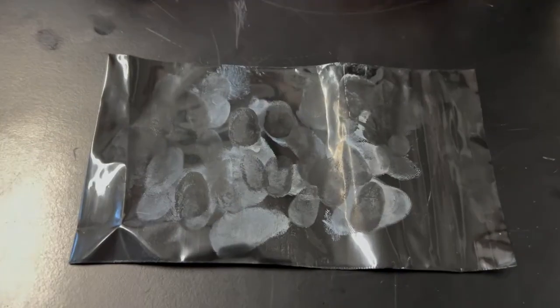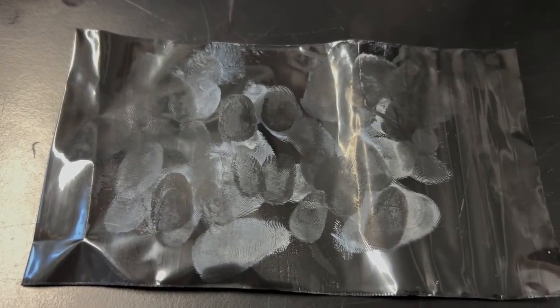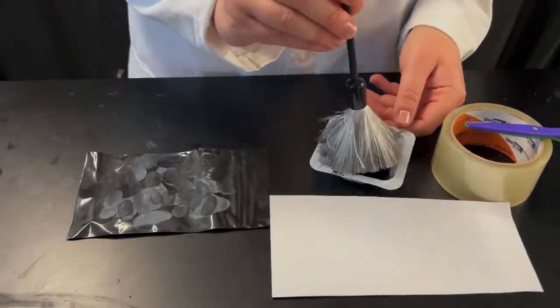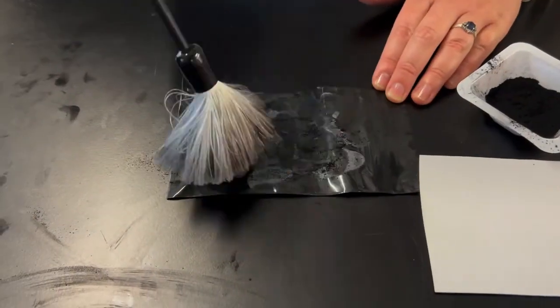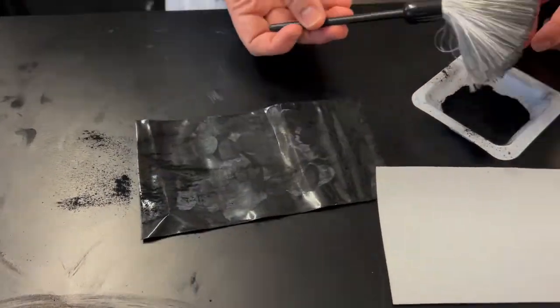These fingerprints can now be documented, photographed, and analyzed as they are. Optionally, fume prints can also be dusted and lifted to provide additional detail and analysis.